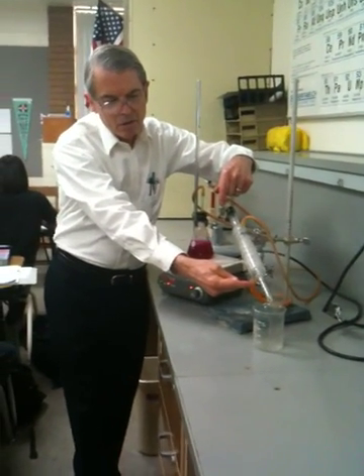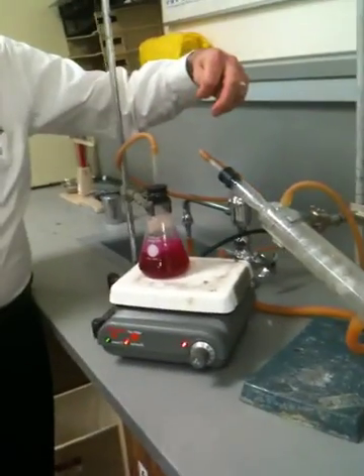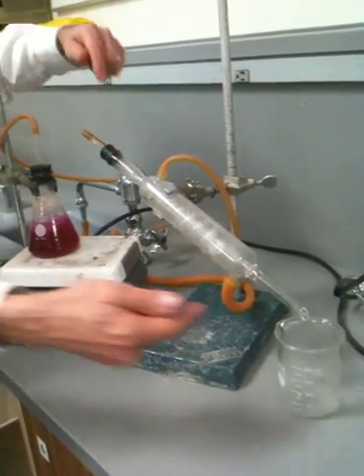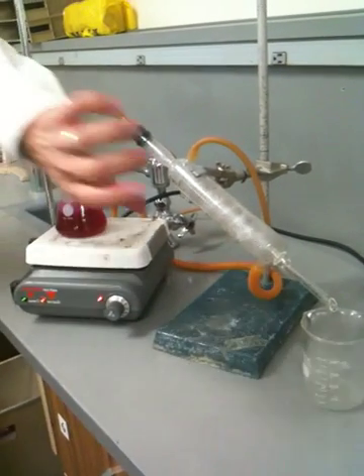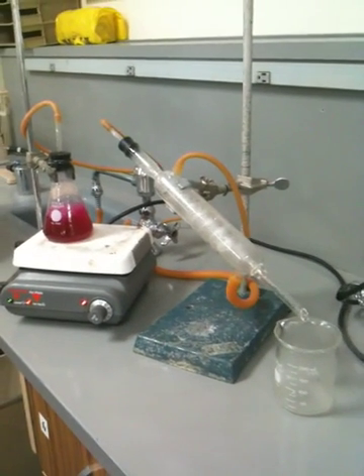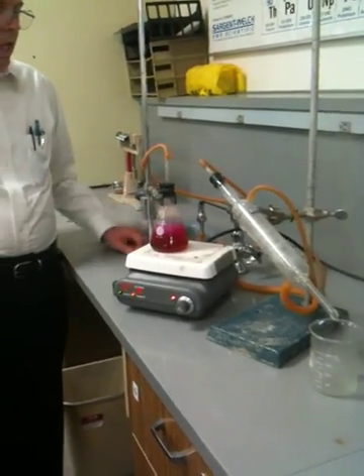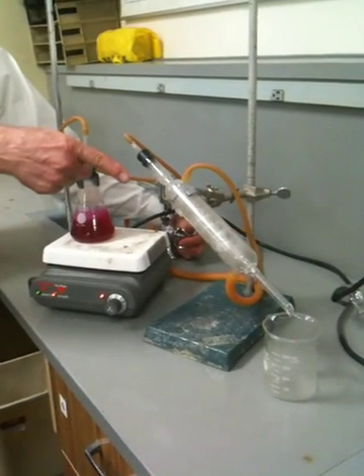And this is a condenser. Come over here and look at it from the side — get in nice and close. We can see little curlicues in there. That's the connection between this opening and this opening. There's also a nice big sleeve here that goes around that curlicue, and we can put water in that sleeve. I have it all hooked up — this hose is going to the faucet.